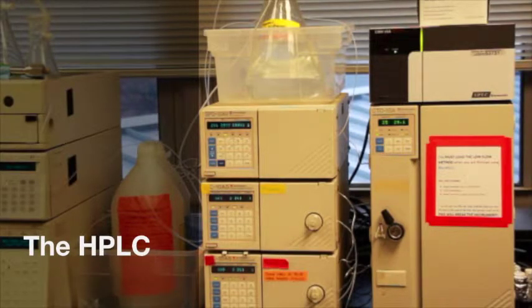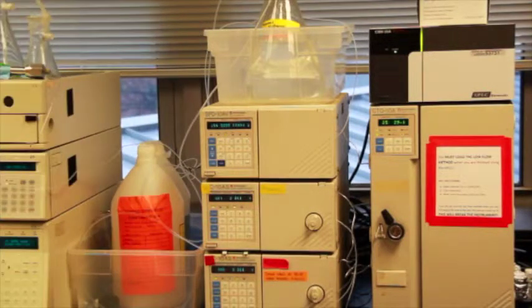Welcome back everybody. Today we're going to be working with the HPLC and just a few quick details to check before you get started on the HPLC lab. The first thing you want to do when this instrument is up in your rotation is come in and check the solvents.